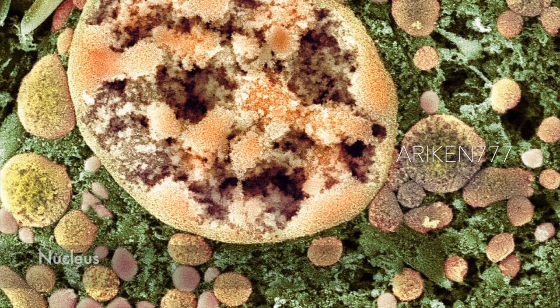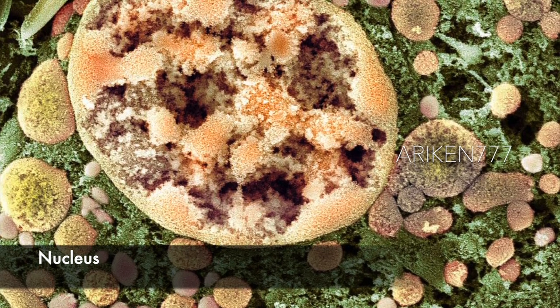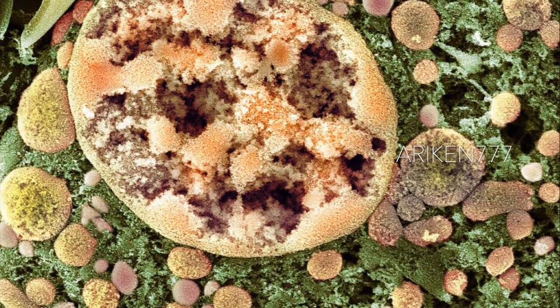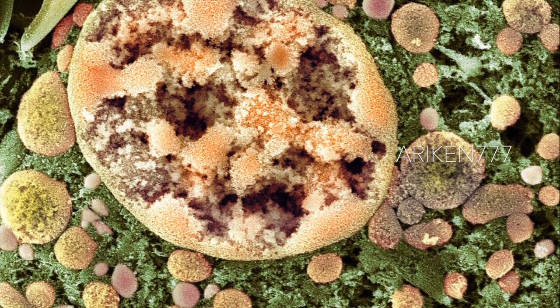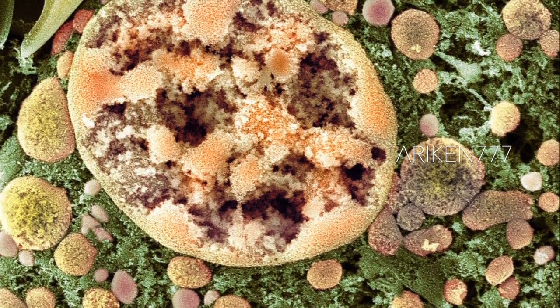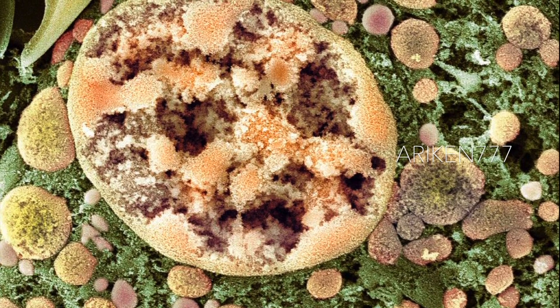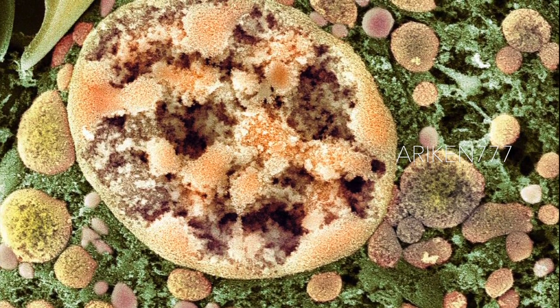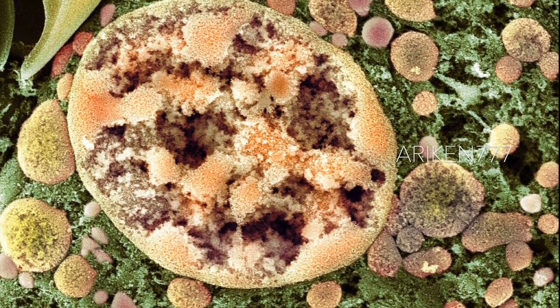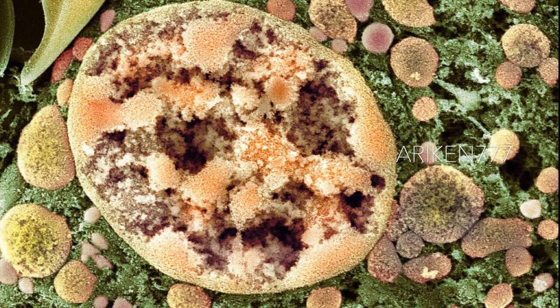A section through the nucleus of a kidney cell. The cell nucleus contains the cell's genetic information in the form of DNA. Here the DNA is complexed with proteins to form chromatin, which are the light brown structures in this image. Surrounding the nucleus are mitochondria, which supply the cell with energy.